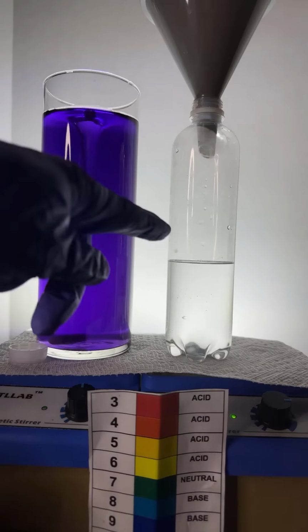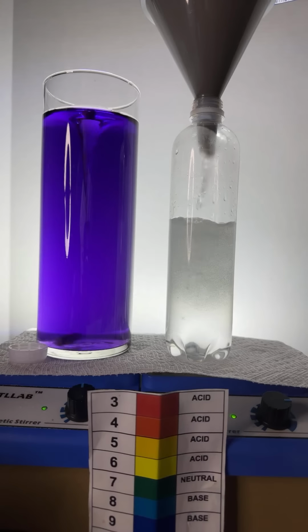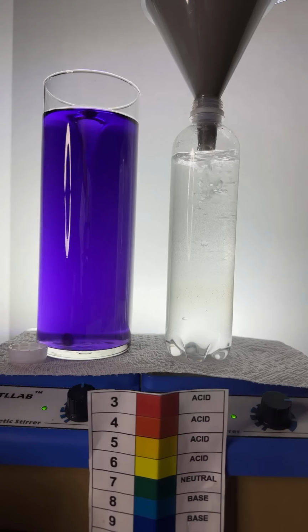Okay, here we go. We got water in here. I'm now going to add some acetone, and it goes. Adding the acetone. Looks kind of cool, doesn't it? You can kind of see that the two don't easily mix, right? There's kind of like 2 layers. The acetone is kind of staying on the top because it is indeed less dense than the water.